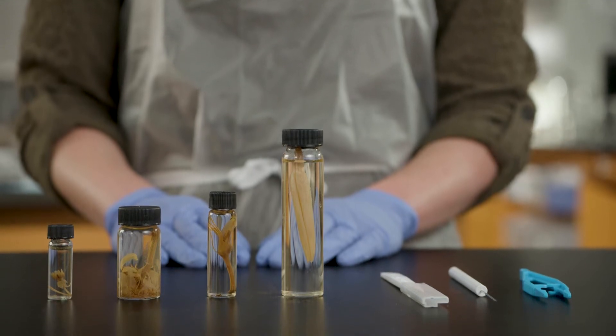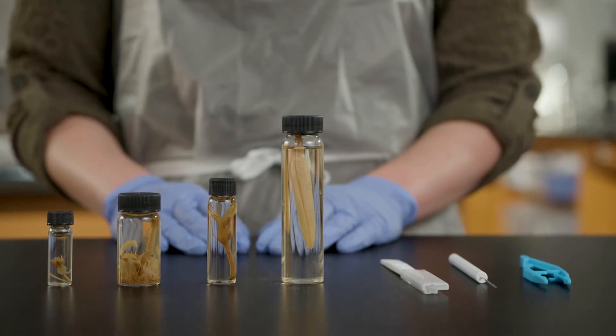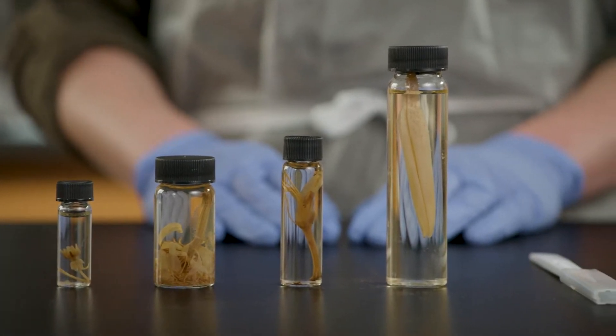This video tutorial will highlight some of the delicate parts of preserved flowers and offer suggestions for working with your specimens.